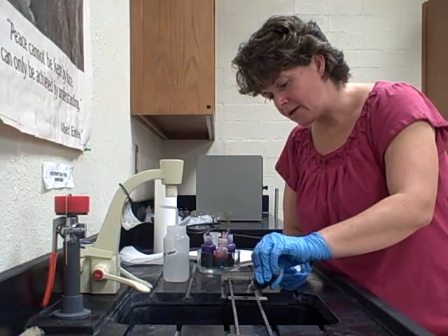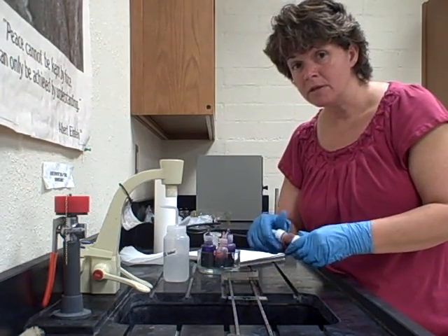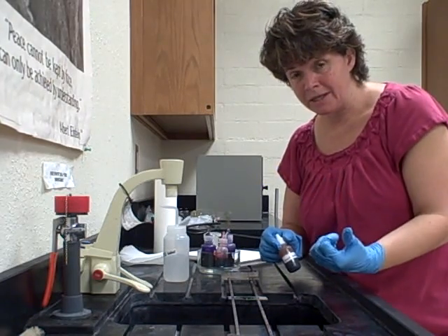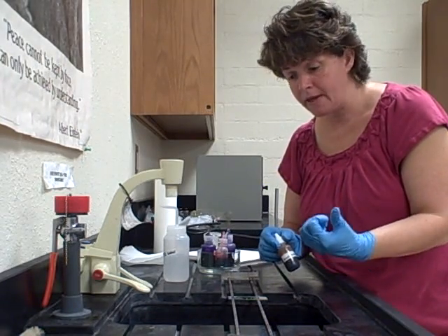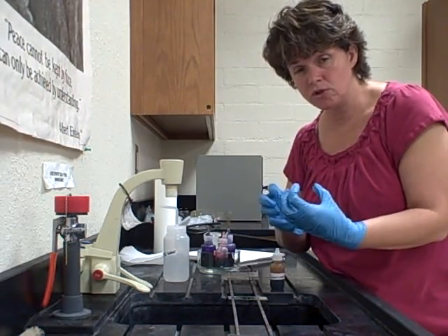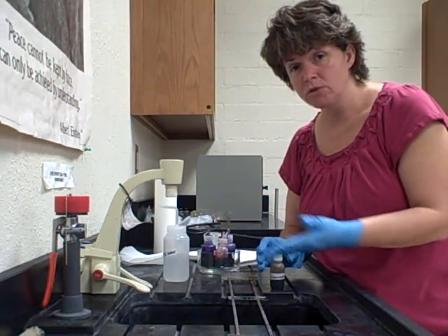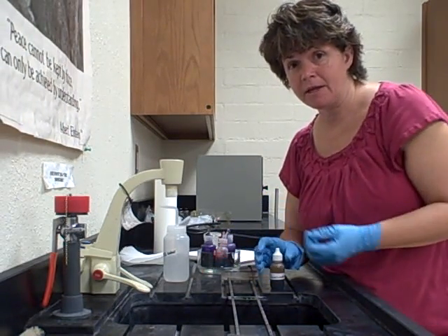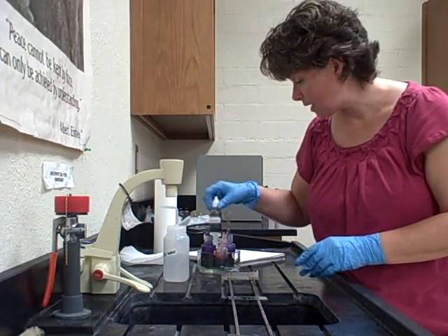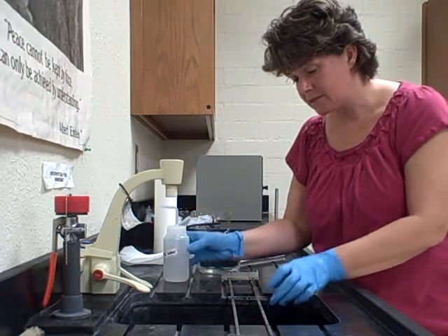The gram's iodine is the mordant. If it's a gram positive cell, the iodine will make a complex with the crystal violet, pulling it into the wall. Then when we go to the dehydration step, those crystals will stay in the wall. If you skip the mordant, you'll lose your crystal violet and end up with a false negative.